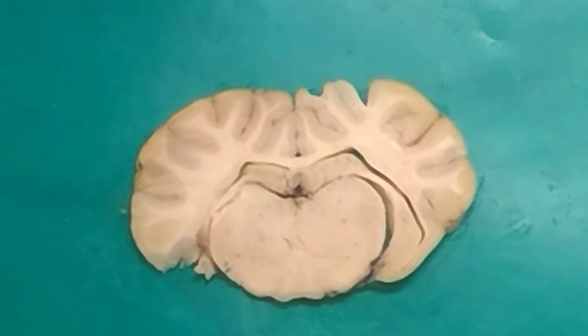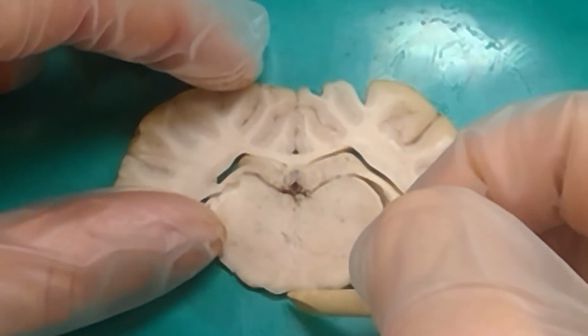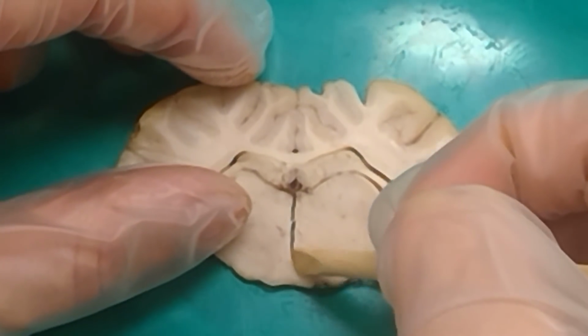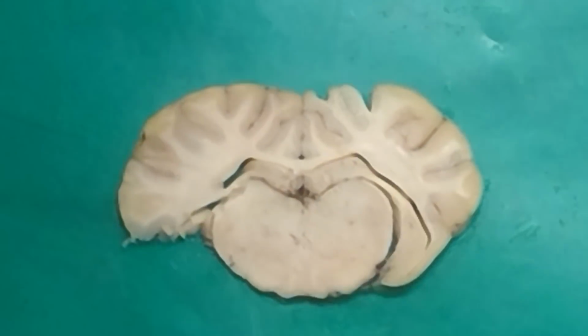Are we going to be able to see the structure that connects the thalamus? You can definitely see it. I'm not going to be able to really point it out. I mean, it should be there at this point. It's kind of this bottom. There should be a portion that's right here that's going through the middle. When we're doing these coronal cuts, a lot of times it'll tear pretty easily.